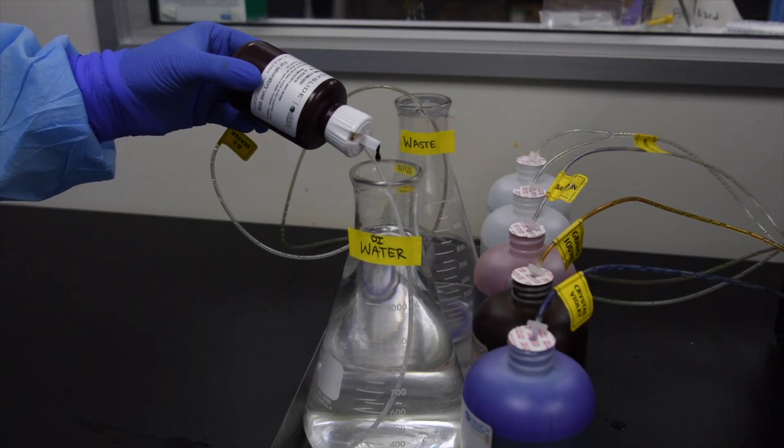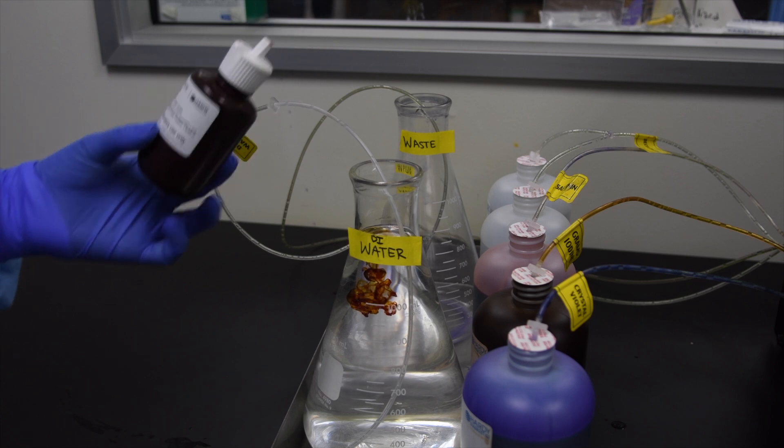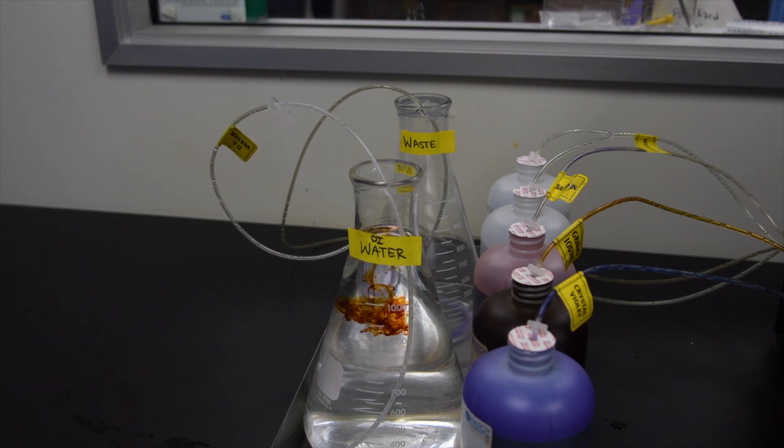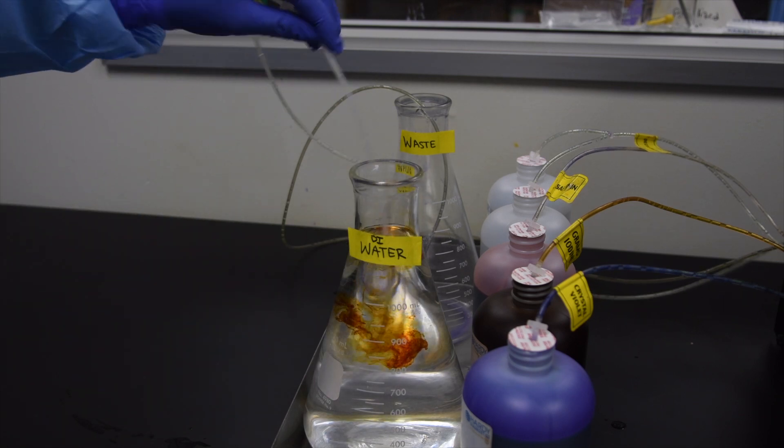No matter how many slides your lab processes each day, replace the deionized water and supplement it with 10 drops of grams iodine disinfectant per gallon of water.